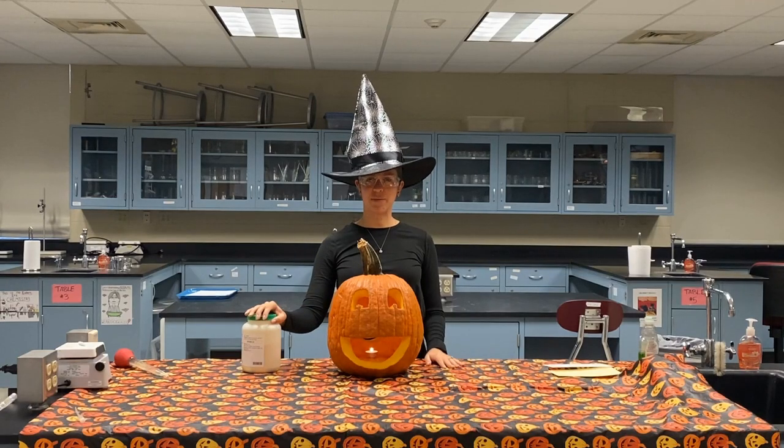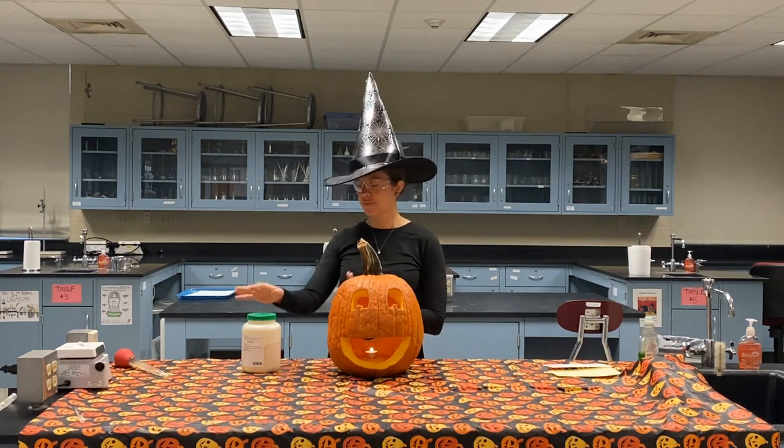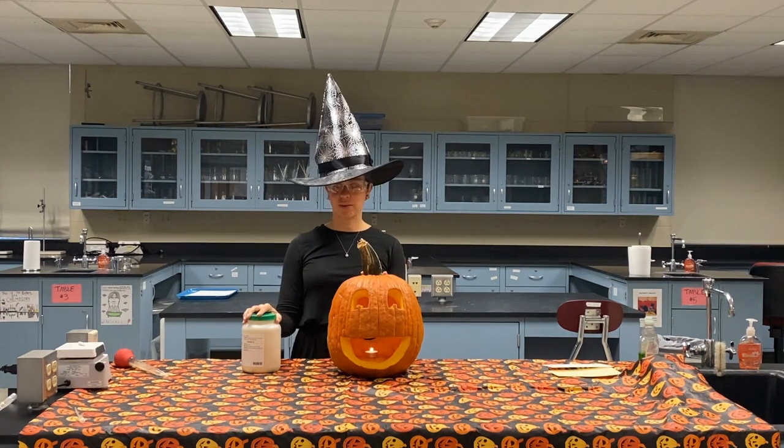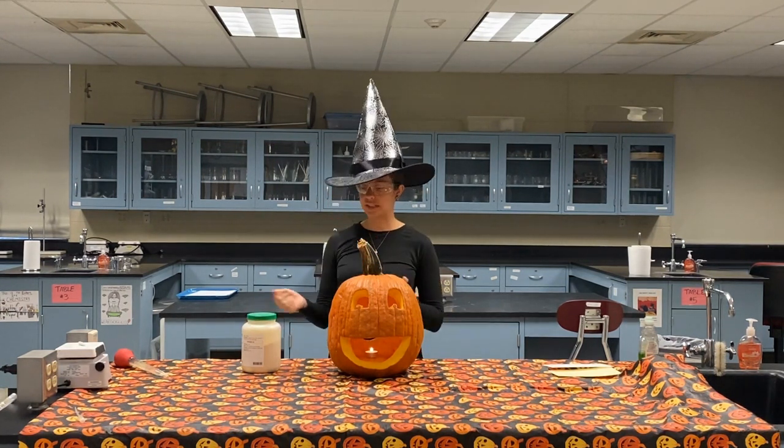Hi students, Mrs. Roberts here again. For our grand finale, we're going to do our fire-breathing pumpkin. Now, before I turn the lights off, I want to tell you a little bit about what I'm working with here. So we have our pumpkin, obviously, and we have a tiny little candle inside of there.